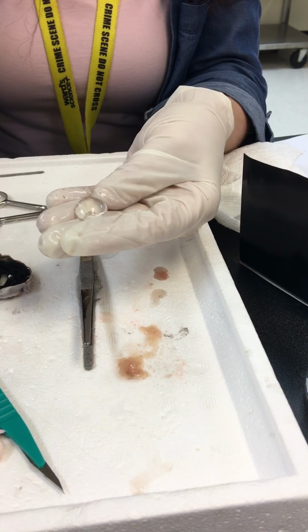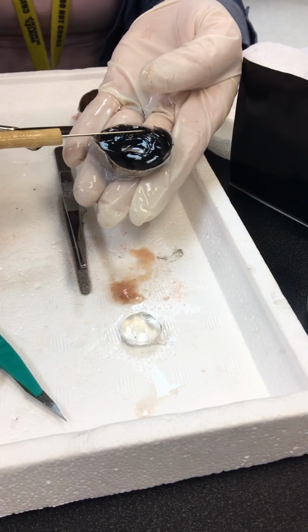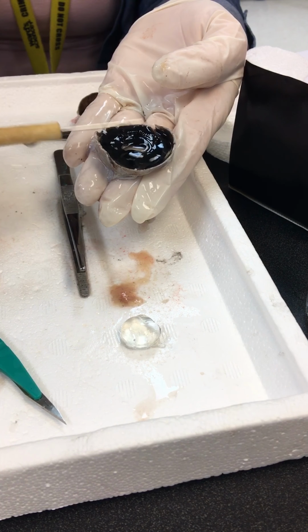You did see these striations, so that is your ciliary body, okay? That's the anchor. Can you see those striations, those lines? I don't know if you guys can see that or not. So at least we were able to see the ciliary body. We couldn't see the ligaments, but I've got a video where we can see those, unless there are any that are still here. Okay, and then right behind that is, what is this other structure back here called?